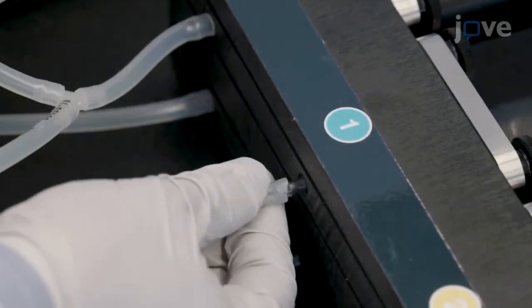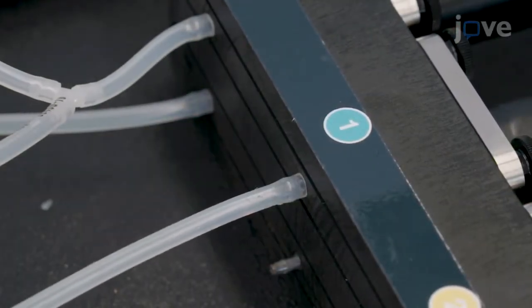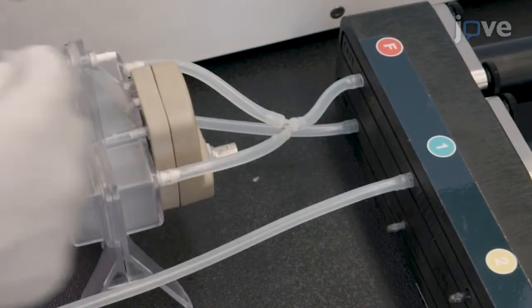Connect the stage 1 tubing from the waste port of the acoustophoretic chamber to a cell collection vessel via the stage 1 pump.